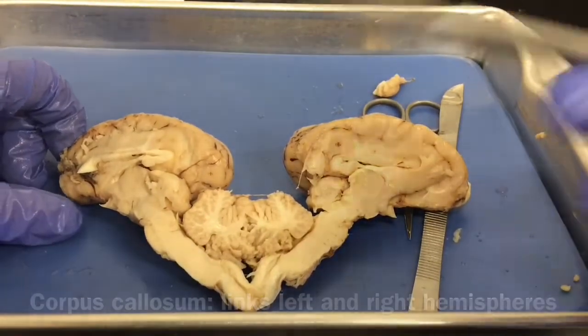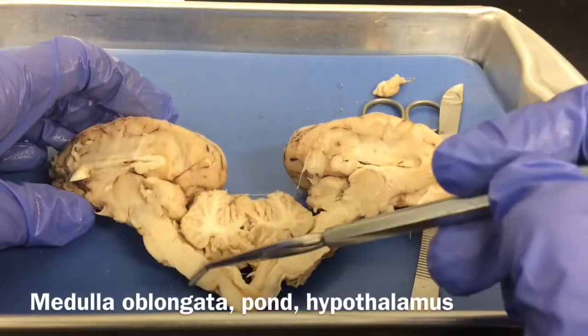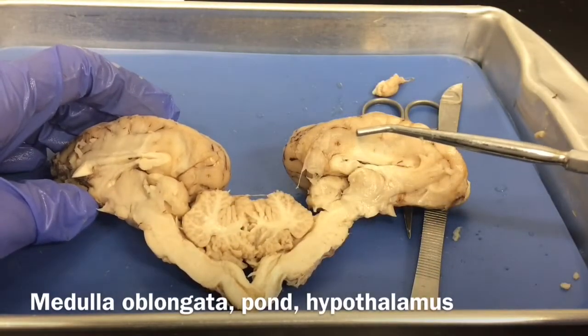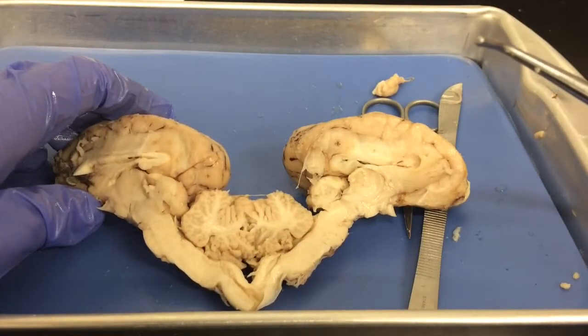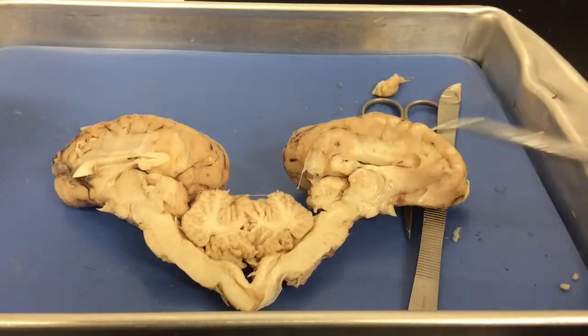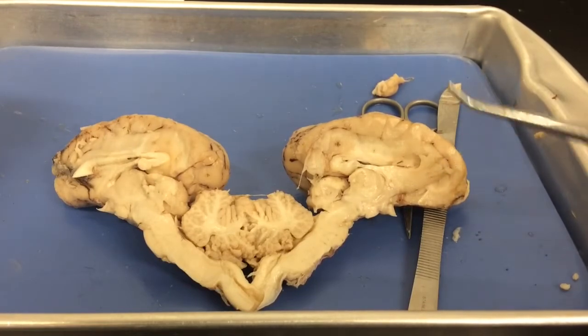And we have our thalamus, which is here. That should be clearly visible. Our medulla oblongata is here, our pons. We have our hypothalamus, which may be a little bit more difficult to visualize. Remember, that is going to regulate a lot of our body functions, like our heart rate, our body temperature, hormone levels, those kind of things. But as you go through, try to identify as many structures as possible according to your dissection guide.